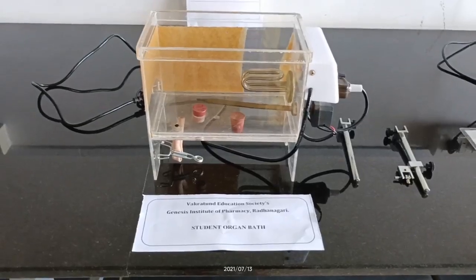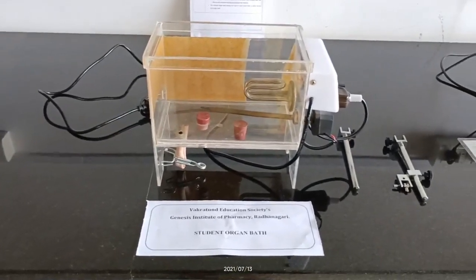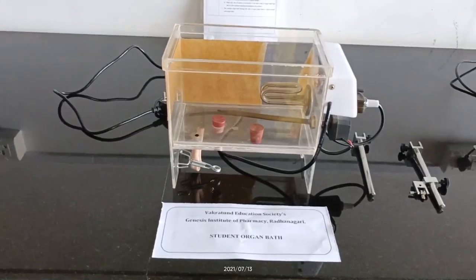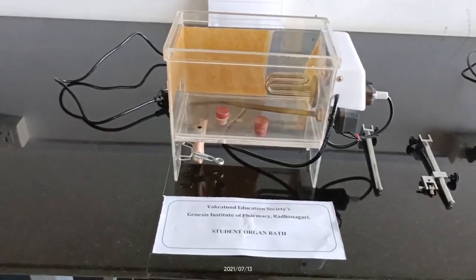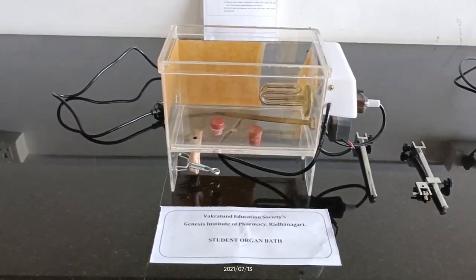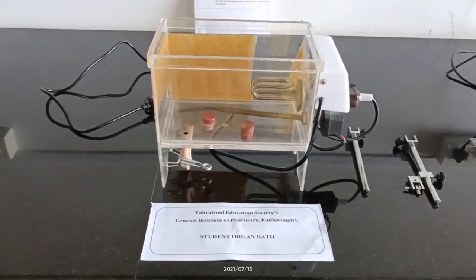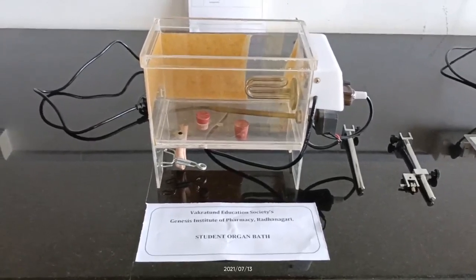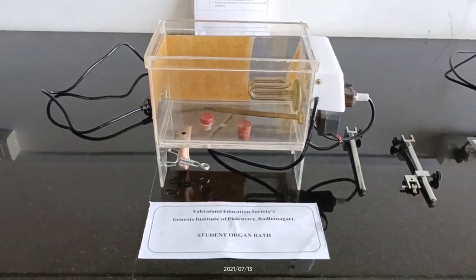So let's move towards the student organ bath. Before starting the explanation, I want to clear some basic concepts. For checking the drug effect on animals, we should use three methods.